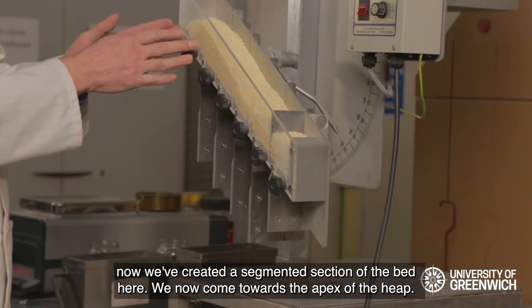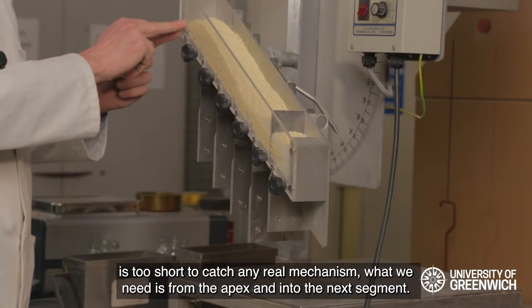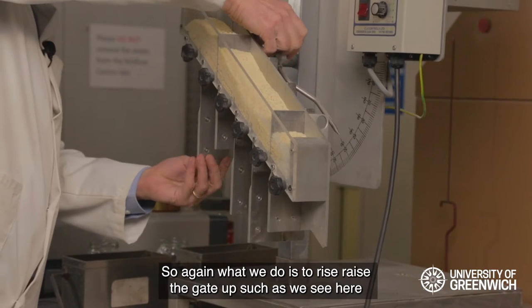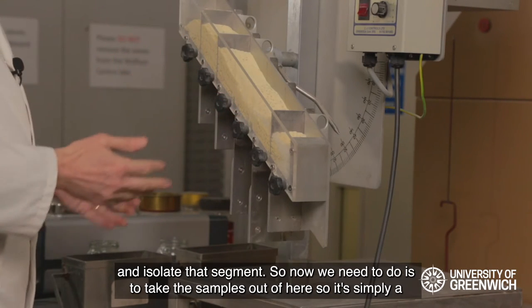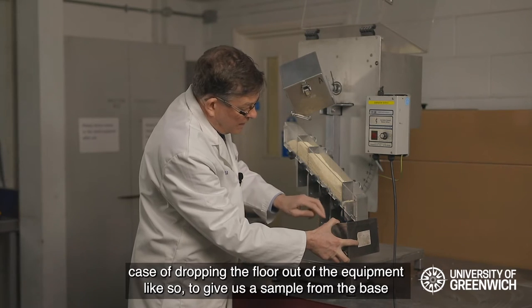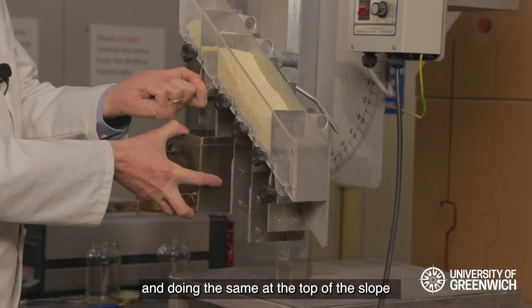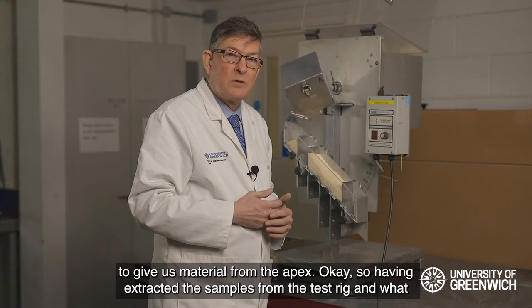Now we've created a segmented section of the bed. We come towards the apex of the heap — we don't want the material to the left of the apex because the slope length there is too short to catch any real mechanism. We need from the apex into the next segment, so again we raise the gate up to isolate that segment. We then take the samples out by simply dropping the floor out of the equipment, giving us a sample from the base and doing the same at the top of the slope to give us material from the apex.